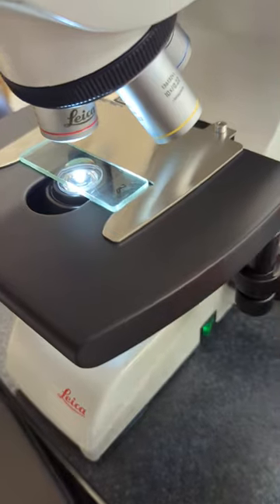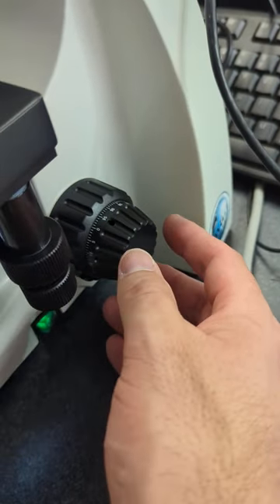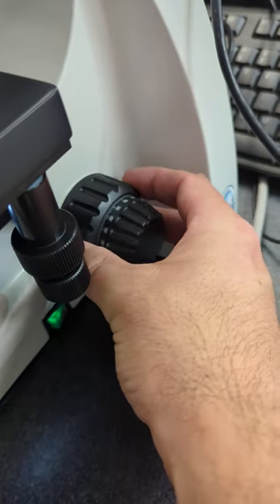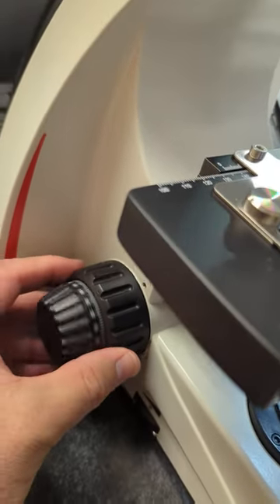Then you focus with either the left side or the right side, fine focus and coarse focus. Both of them—here's the right, here's the left side—fine focus and coarse focus.